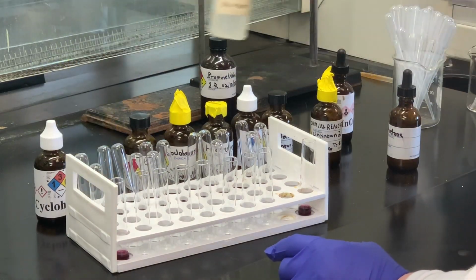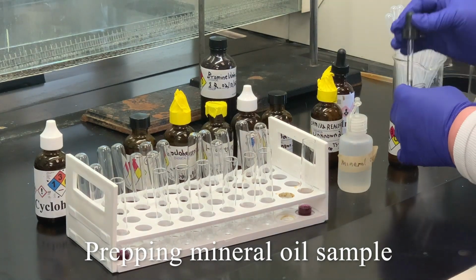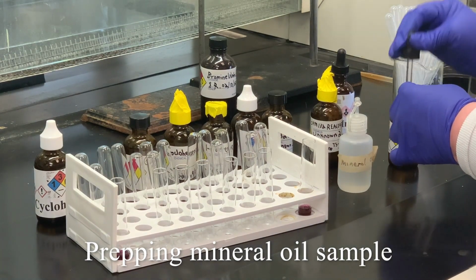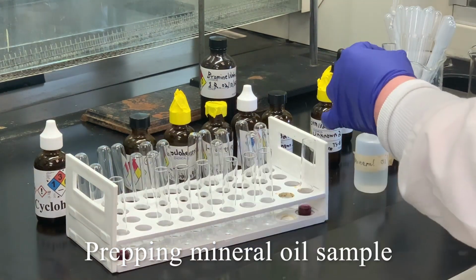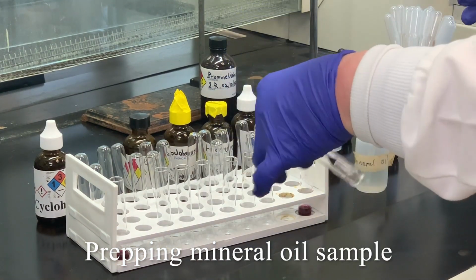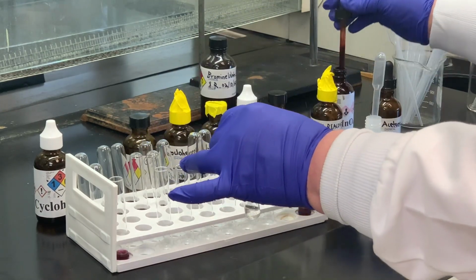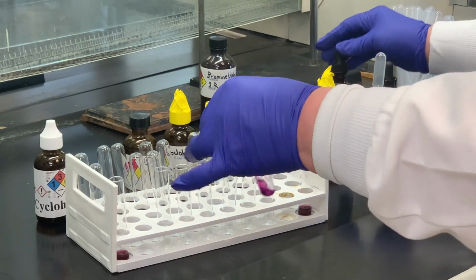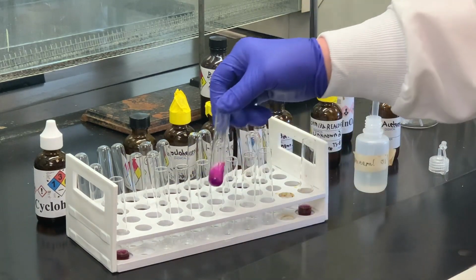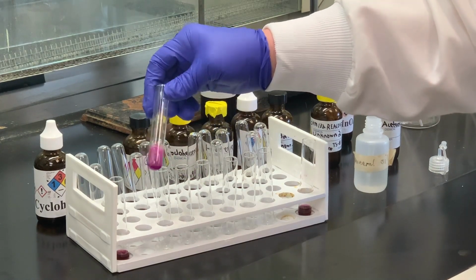Next sample we're going to use is the mineral oil. I'll need to put some acetone into that first to serve as the solvent. A few drops of the mineral oil. And then a drop of our potassium permanganate. And again, that purple color you see, so we would consider that no reaction.